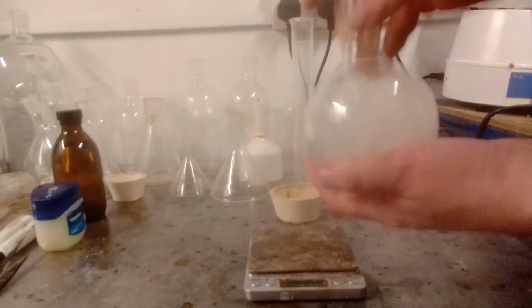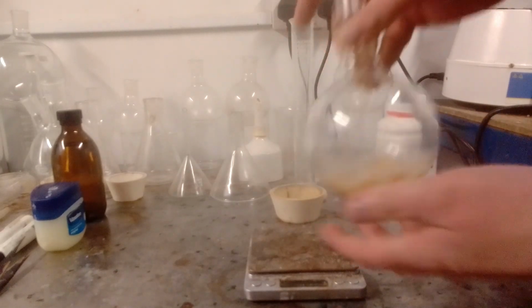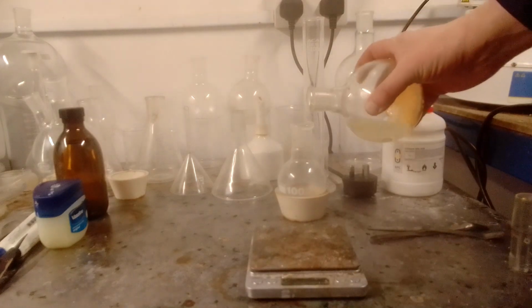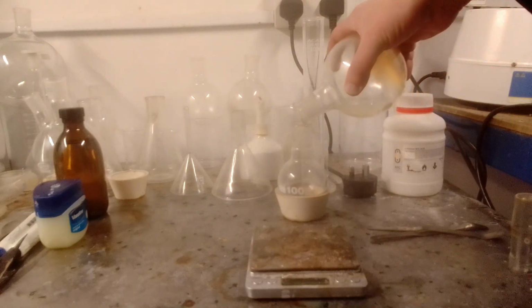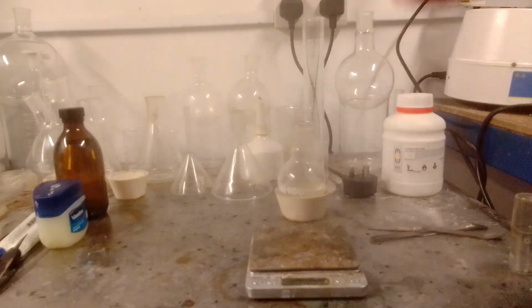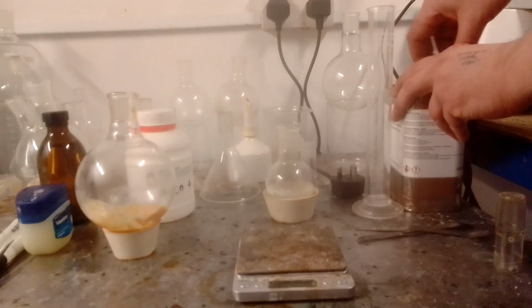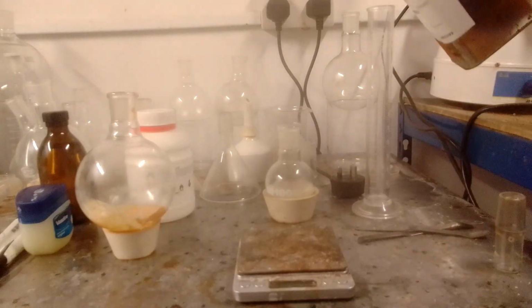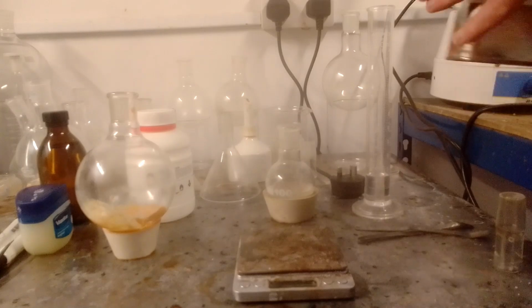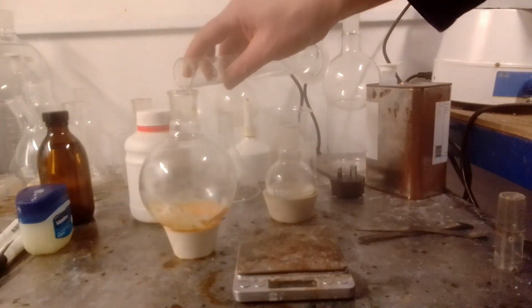The original paper used carbon tetrachloride, but that's very hard to come by these days, and hexane is similarly non-polar. The supernatant fluid was decanted into a smaller flask, though going by the smell, a lot of benzoyl chloride had been left over. On a whim, and because I'd got a very poor yield the last time I used hexane alone, I decided to add 20 ml of dichloromethane to dissolve any remaining product and shift the solid residue.